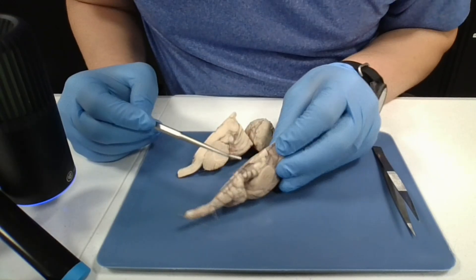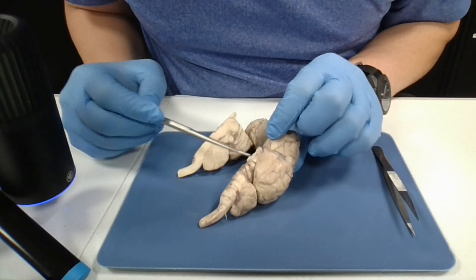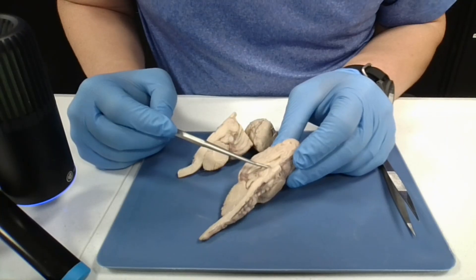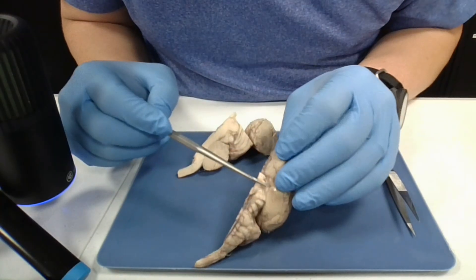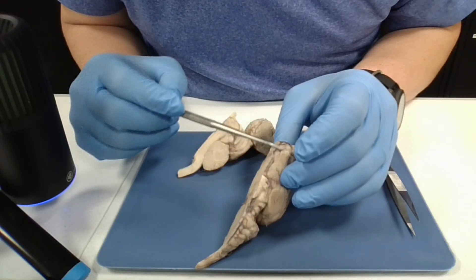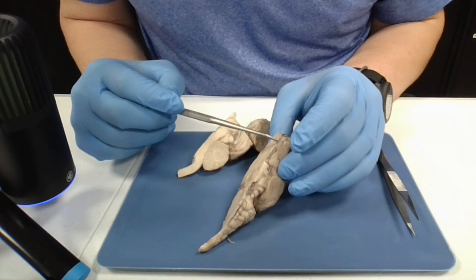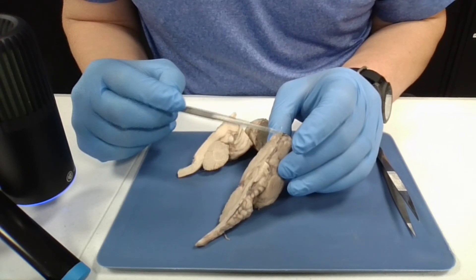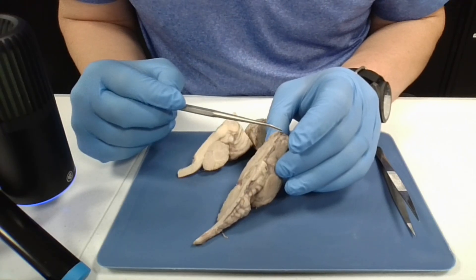There are 12 pairs of nerves that leave the brain. If you look here, you can see some remnants of nerves. One of the main ones is the olfactory nerve coming out here, and the olfactory bulb would be here. The olfactory bulb contains neurons that synapse with other olfactory nerve neurons — olfactory being related to your sense of smell.